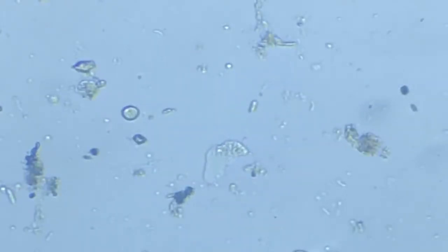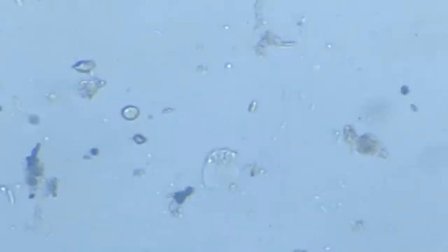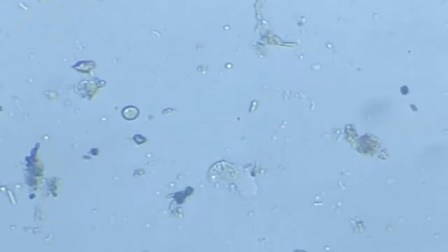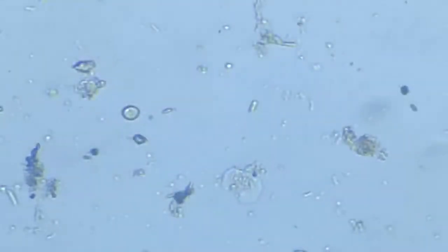Maybe we find it eating some bacteria. There are a few. You can make out those small, white, shiny little droplets. Those are bacteria, rod-shaped bacteria, which it may engulf in the process of movement. So probably it's moving towards the direction in which it is moving. Not now. In fact, right where it is located, if we, oh, that was the big one. That was the big flatworm.